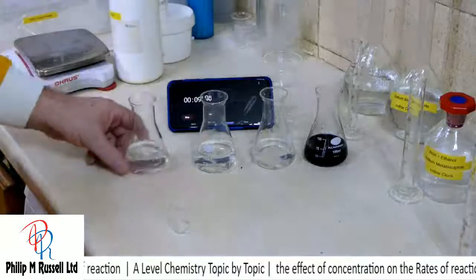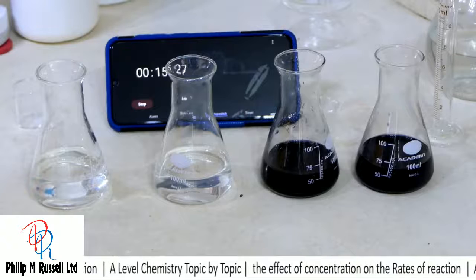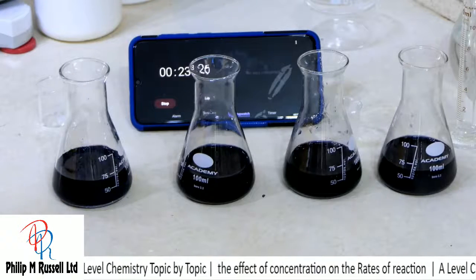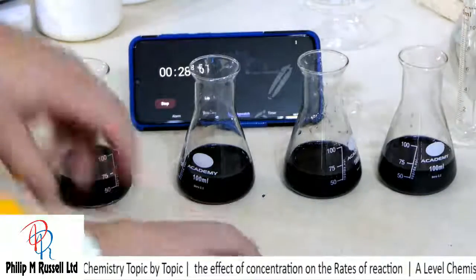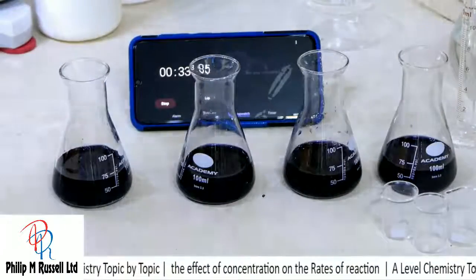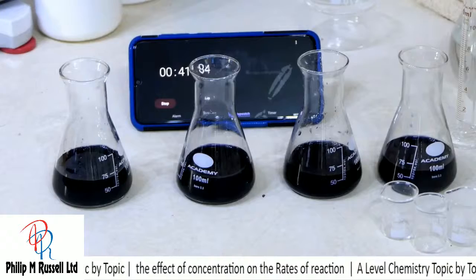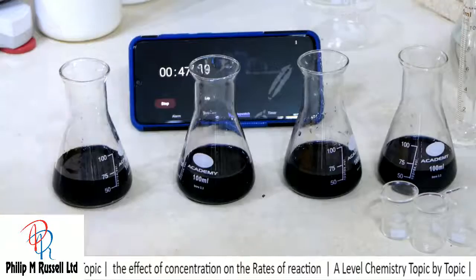This is going to be more difficult, I imagine. Predictions are that they're going to go in order. 1, 2, 3. And we can see that that works really quite nicely. So there we've got the iodine clock experiment. It looks quite a cool experiment, and let's have a look and see what the mechanism for this working is.